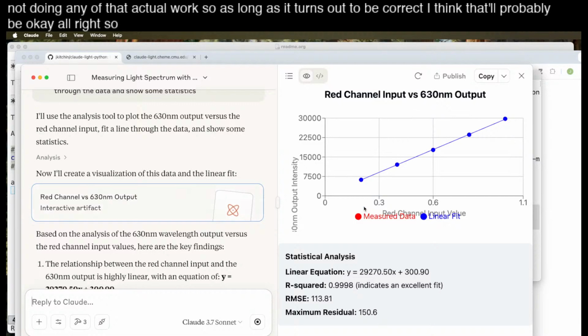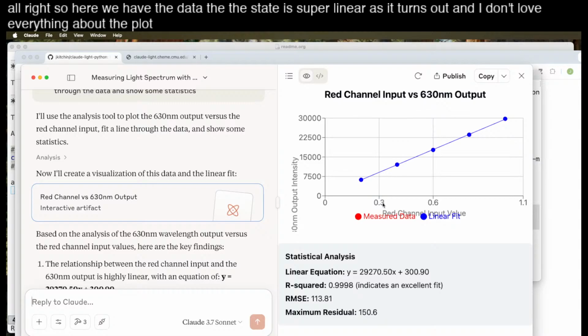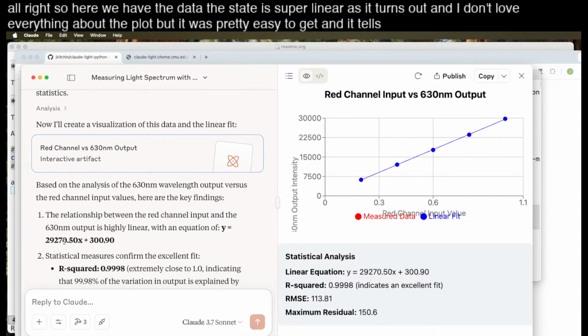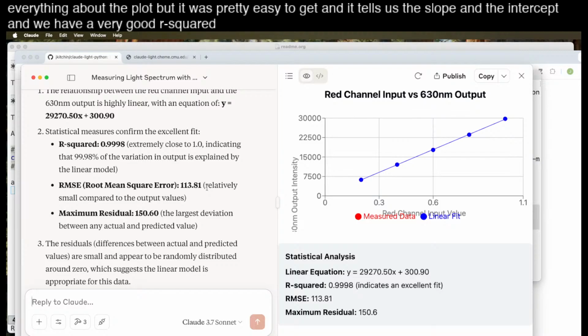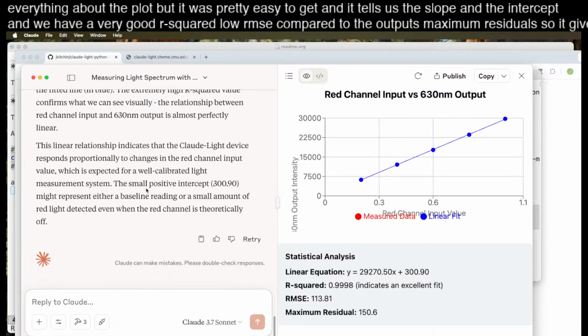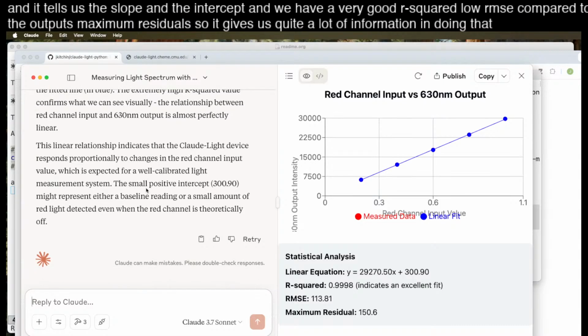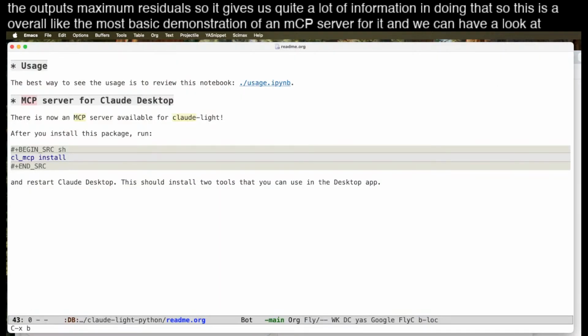All right, so here we have the data. This data is super linear, as it turns out, and I don't love everything about the plot, but it was pretty easy to get. And it tells us the slope and the intercept, and we have a very good R squared, low RMSE compared to the outputs, maximum residuals. So it gives us quite a lot of information in doing that. So this is overall the most basic demonstration of an MCP server for it, and we can have a look at how it is set up.